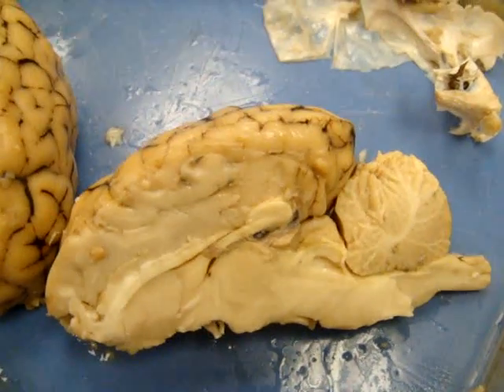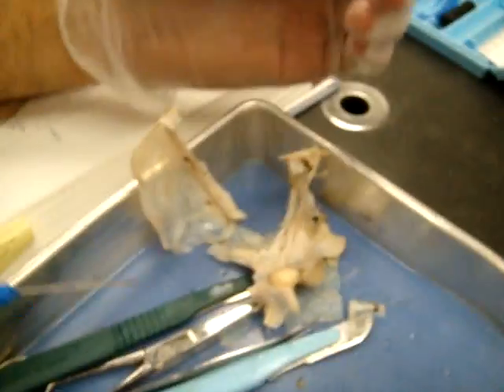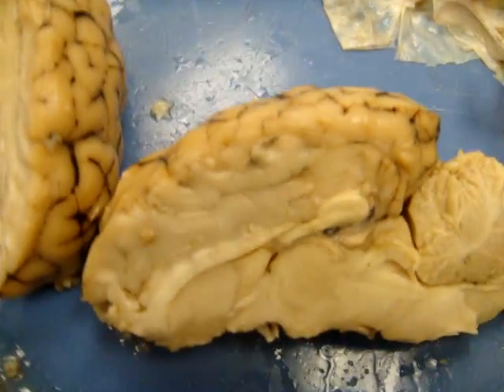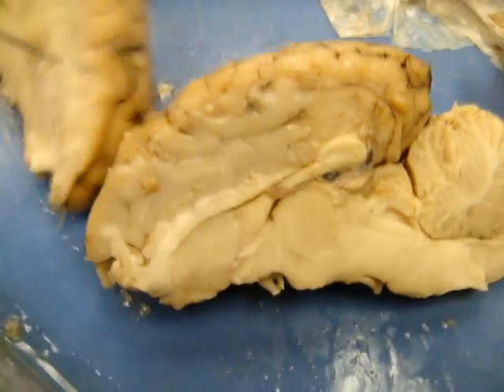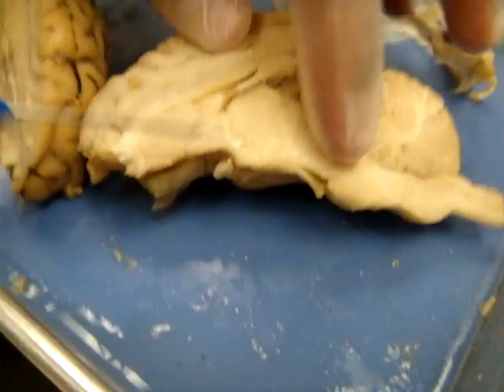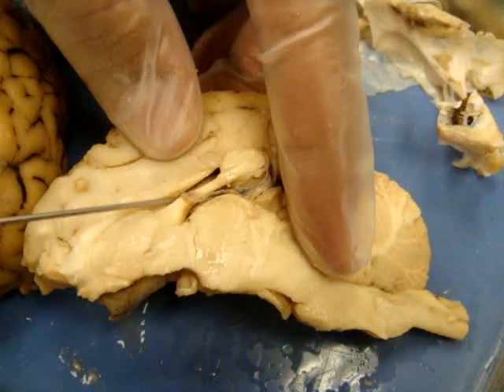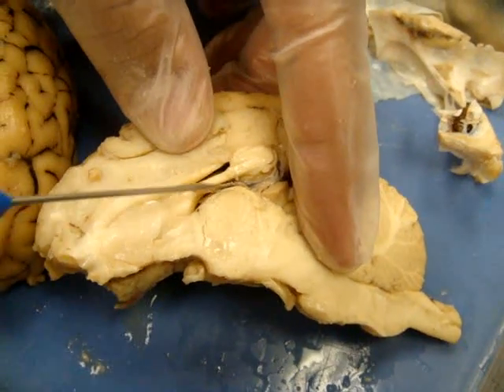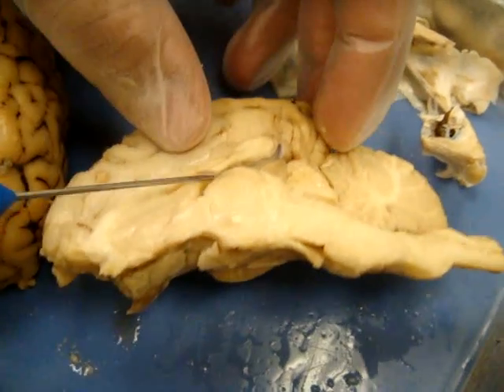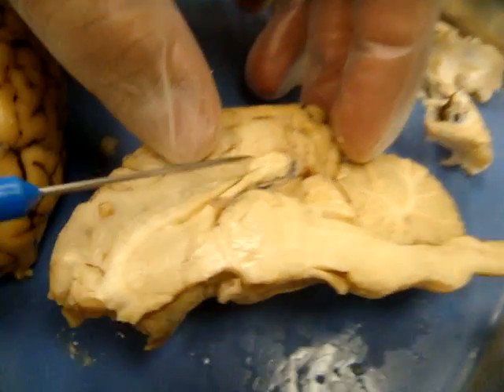I took off the dura mater and the other meninges. Ventricles — do you want to show the lateral ventricle? Is that a big one? And then the third ventricle is just around the thalamus.